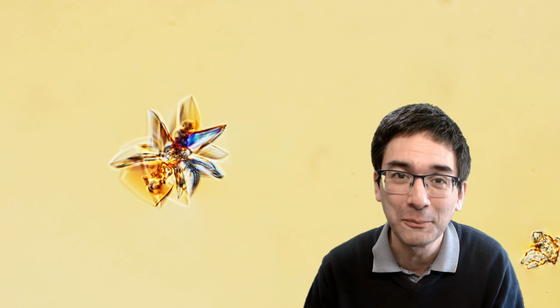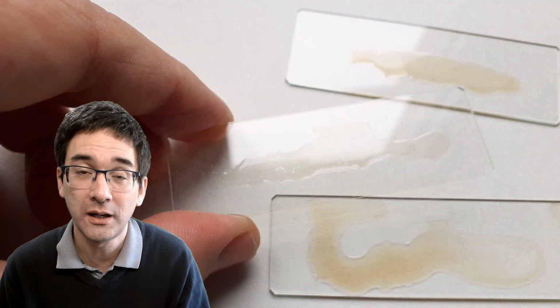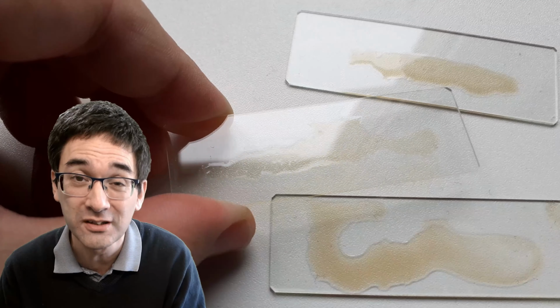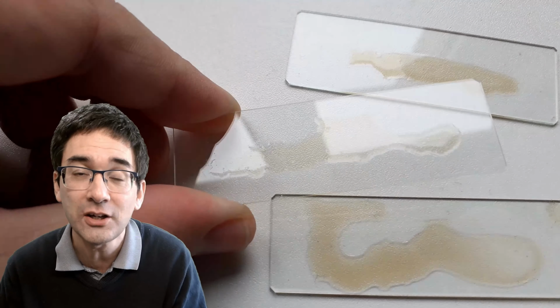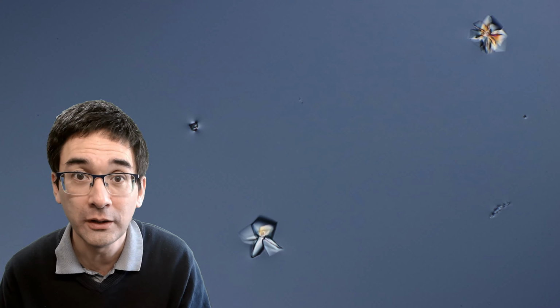I changed the polarization of my microscope a little bit to give it some color, but really the first try was not very successful. I saw very few crystals, they were quite small, so I had to magnify it quite a bit. So I looked again at the slide and was wondering, why am I not seeing any crystals, or only very few of them? And indeed, I did not see any crystallization happening on the microscope slide. So that's basically all I got during the first try.